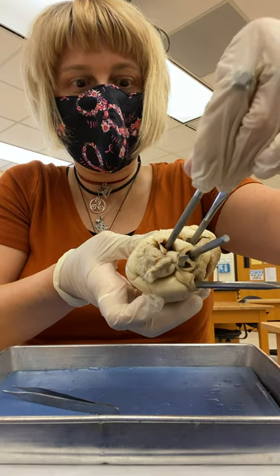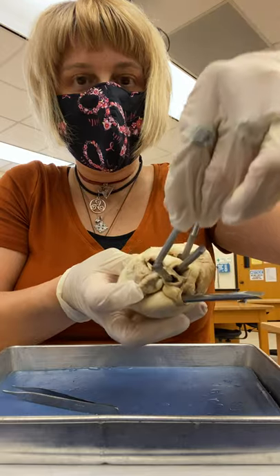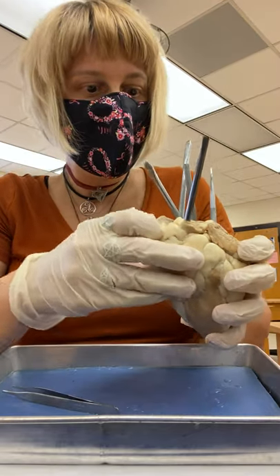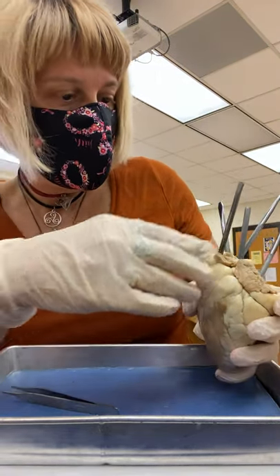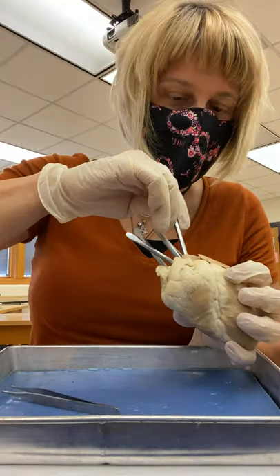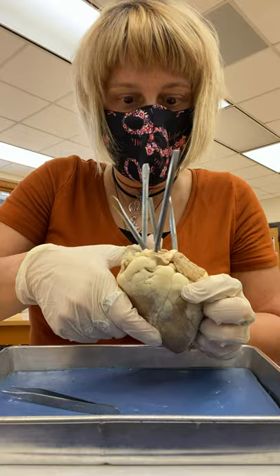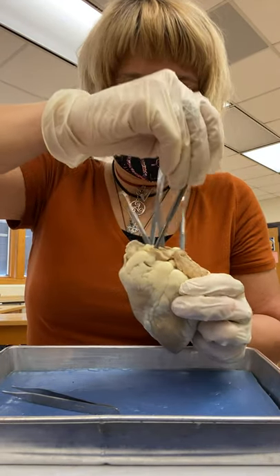Take a peek right there — that's your right atrium. And this is your superior vena cava right there. If you want to take a peek even further, you're going to see that this should be the pulmonary trunk, because if I put my probe through, it's coming from that right ventricle. So there's my right pulmonary trunk.